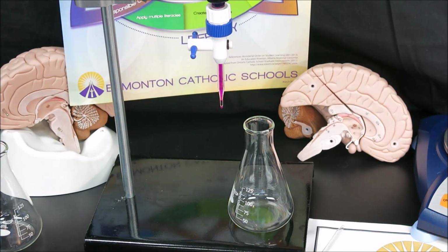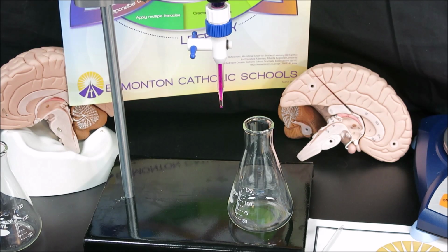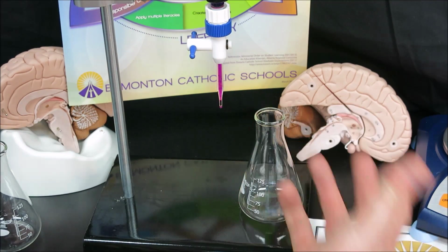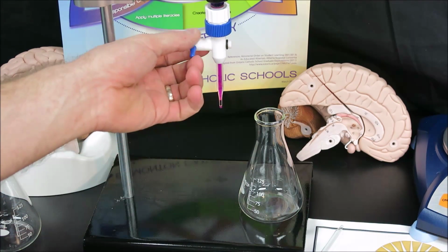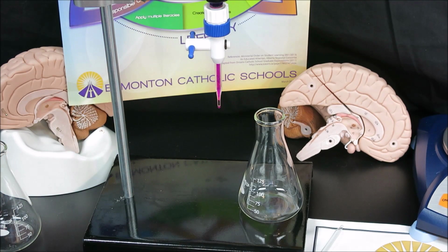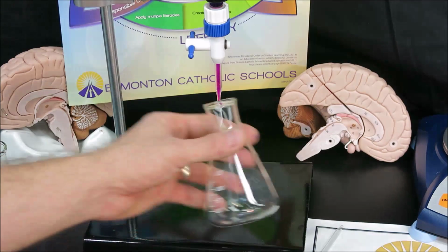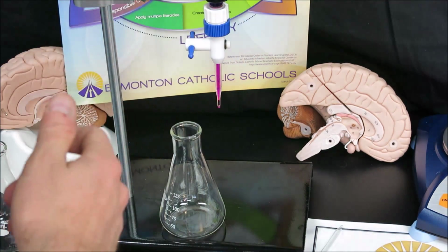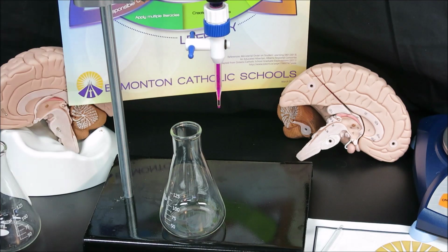To titrate, there are several methods, and it really depends on your comfort level. I am right-handed, and so I want to be able to swirl my flask with my right hand because I have more control over that hand. And what I'll do is I'll operate the stopcock with my left hand. However, some people are perhaps more comfortable the other way, and you will swirl with your left hand and operate the stopcock with your right hand. You can turn the burette around. It really does not matter if you can read the numbers at this point.